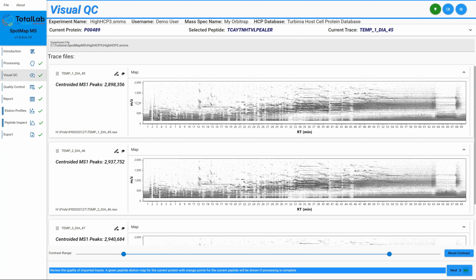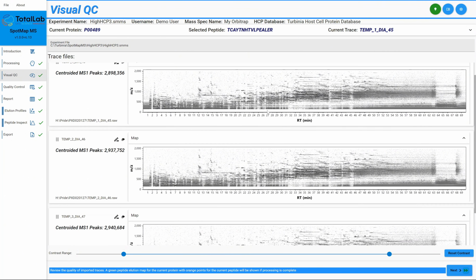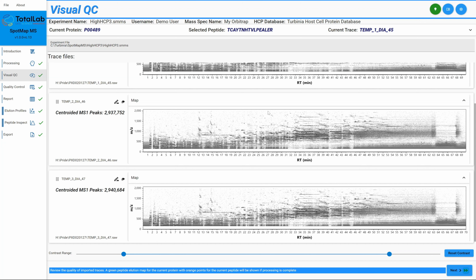You can see that we've got our mass charge ratio on the left-hand axis, and our retention time in minutes on the x-axis. I may have got those the wrong way around, I can't quite remember. This is a visual view of mass over charge versus retention time, and for this experiment, these are replicates. These should look similar, and if you're running a very well-characterized workflow, these should look very similar every time. If you're running the same sample day in, day out, you should be able to recognize these patterns.